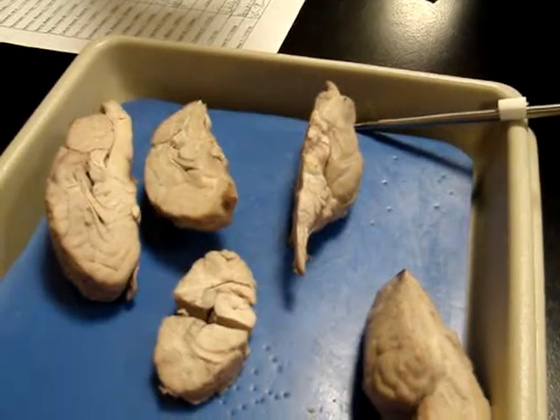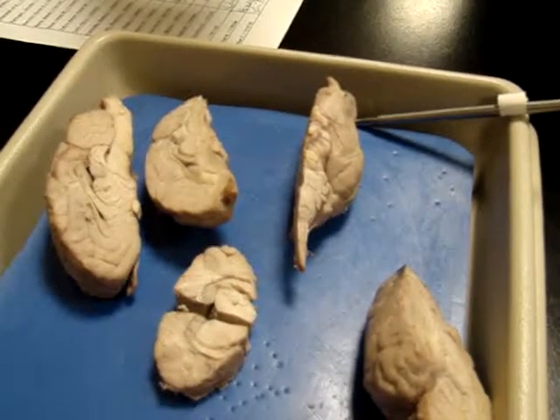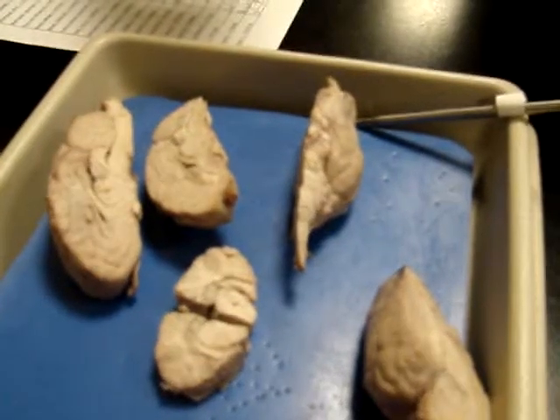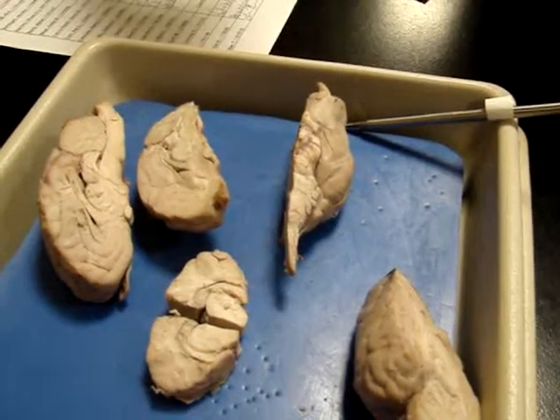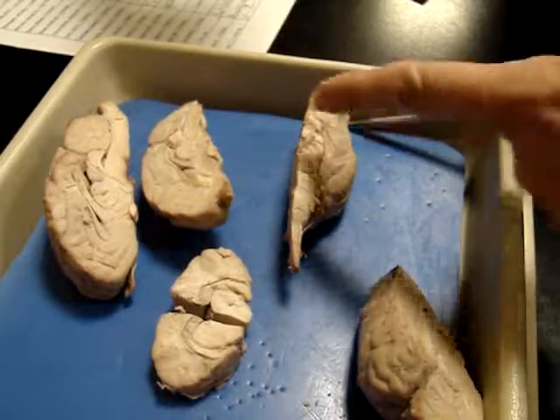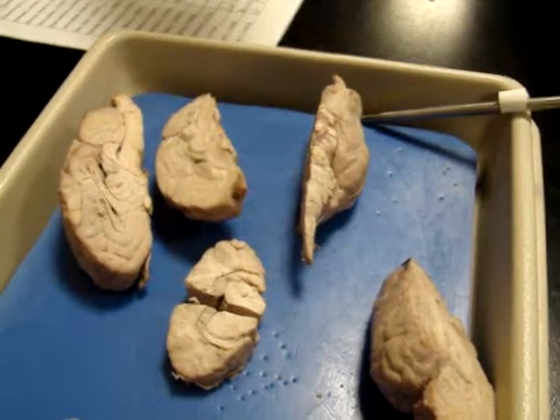So those are, and actually those are cranial nerves 1, 2, and 3. I always remember this little mnemonic, Odessa Ophelia O'Connor takes tests amazingly. You can remember Oprah, you can make it whatever you want. But it's olfactory nerves, optic nerves, oculomotor nerves. The 3 O's come first. So 1, 2, then oculomotor. I'm just talking about the 3 cranial nerves. Yeah, your cranial nerves, because you have to learn them all.